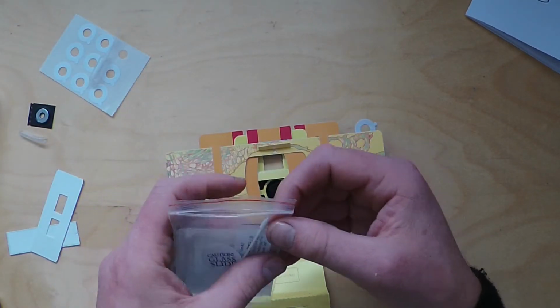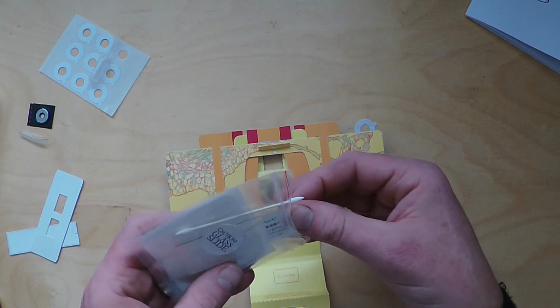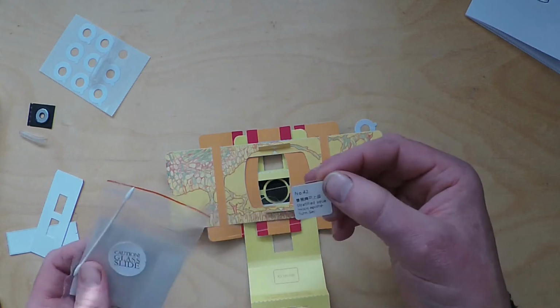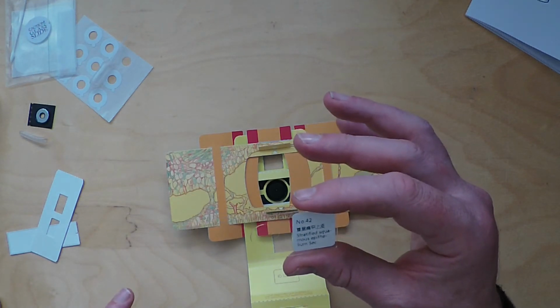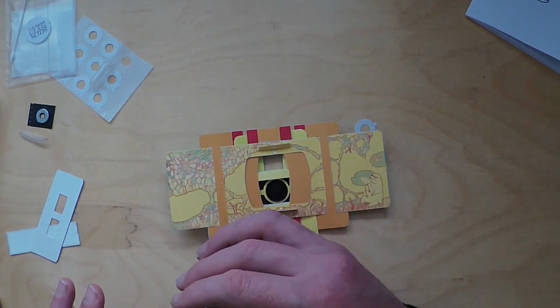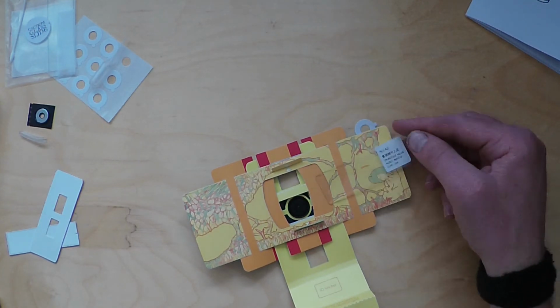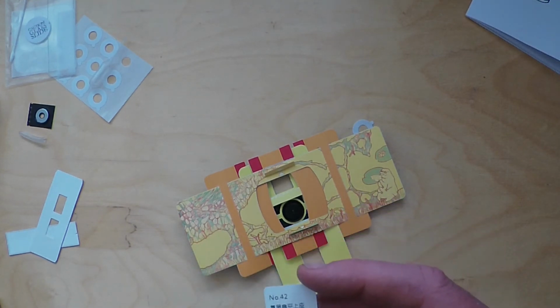Go back to your little caution glass slide bag. Make sure your hands are clean, by the way. I've cleaned my hands with alcohol before. Beware of the blank slide, which we're going to use for making our own samples later. And you just want to take this pre-prepared slide here. And this is a section of skin, I think. So we take that and we place that into our sample. So have a look at the instructions about the kind of slide use. So we provide this kind of reference slide just to get you started quite quickly.